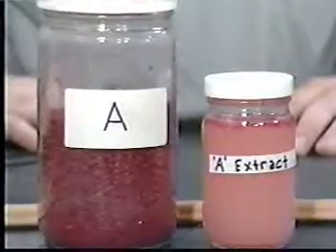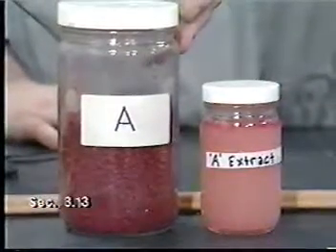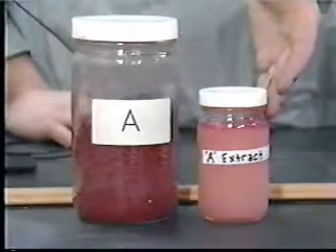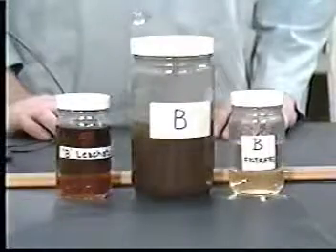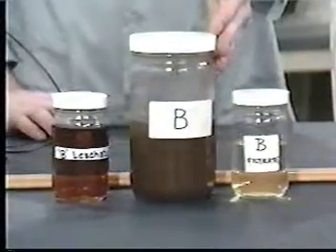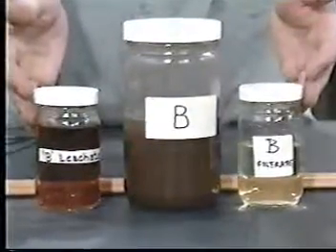In our demonstration, waste A contained 100% solids. Since it had no initial liquid phase, the filtered leachate equals the TCLP extract. Waste B contained an initial liquid phase, which can now be combined with the filtered leachate to form the TCLP extract.